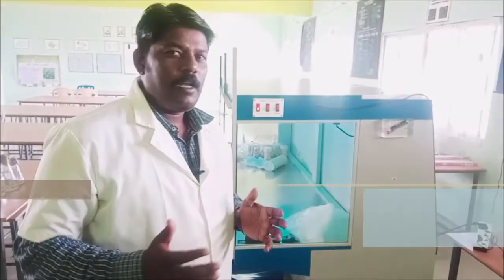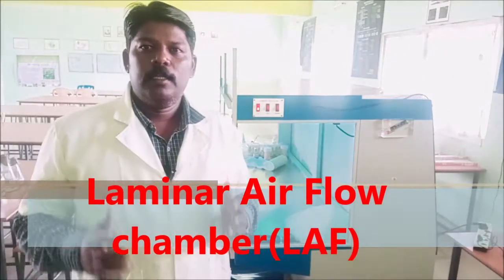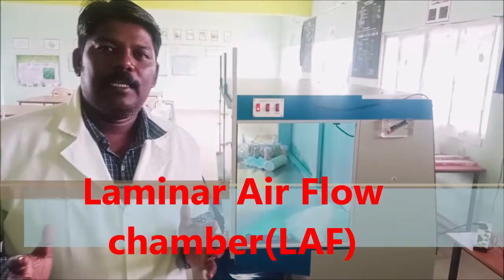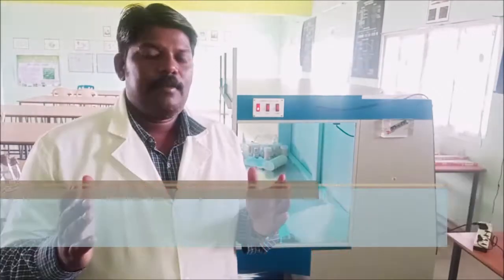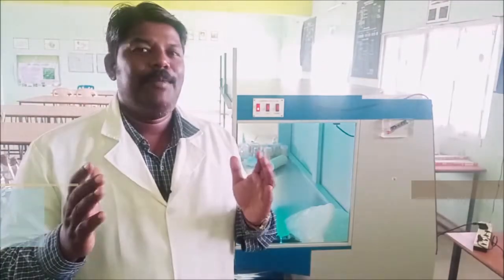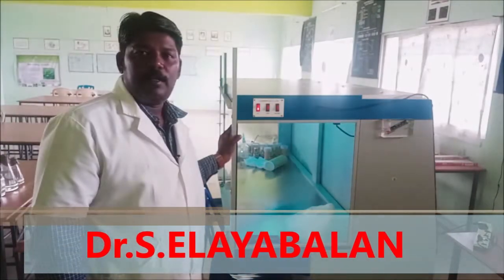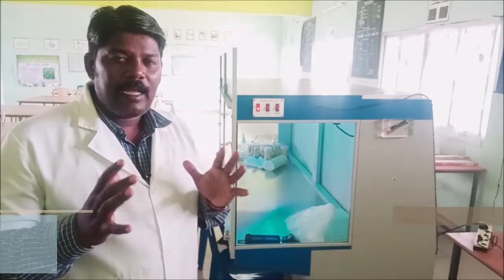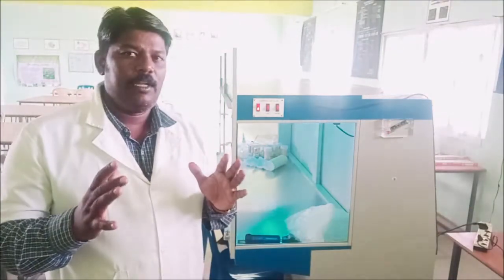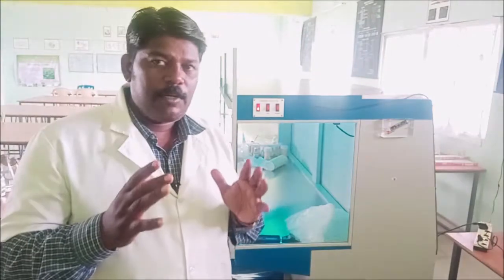Dear students and viewers, in the video you can see a Laminar Air Flow Chamber. This is the Laminar Air Flow Chamber machine, and we will look at its working principle.